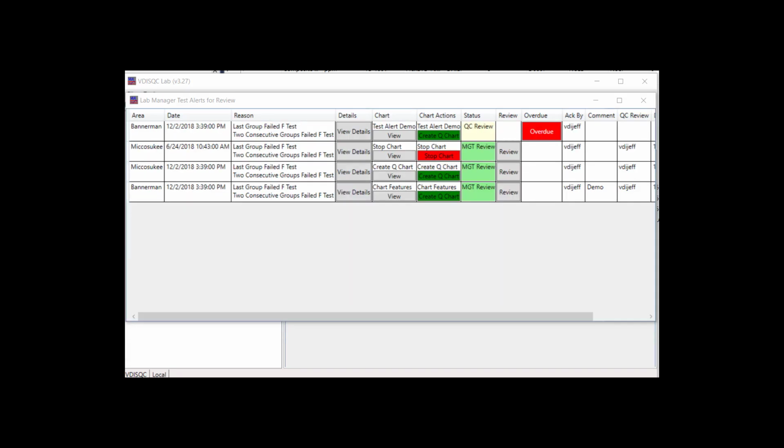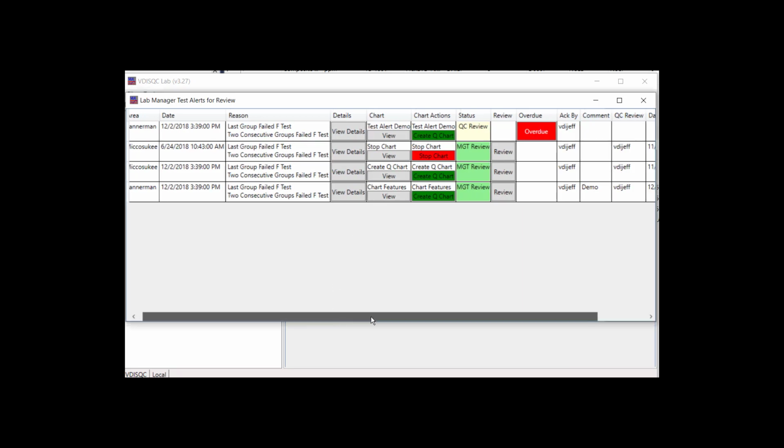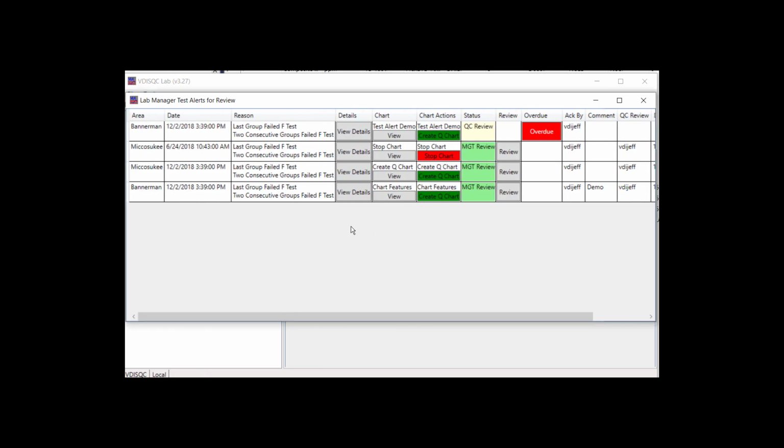Many features are shared with the lab manager review for test alerts. There are details about the alert, as well as a link to view the chart. However, there are also options for chart actions. If two groups fail an F-test individually and against each other, a stop chart action will appear.